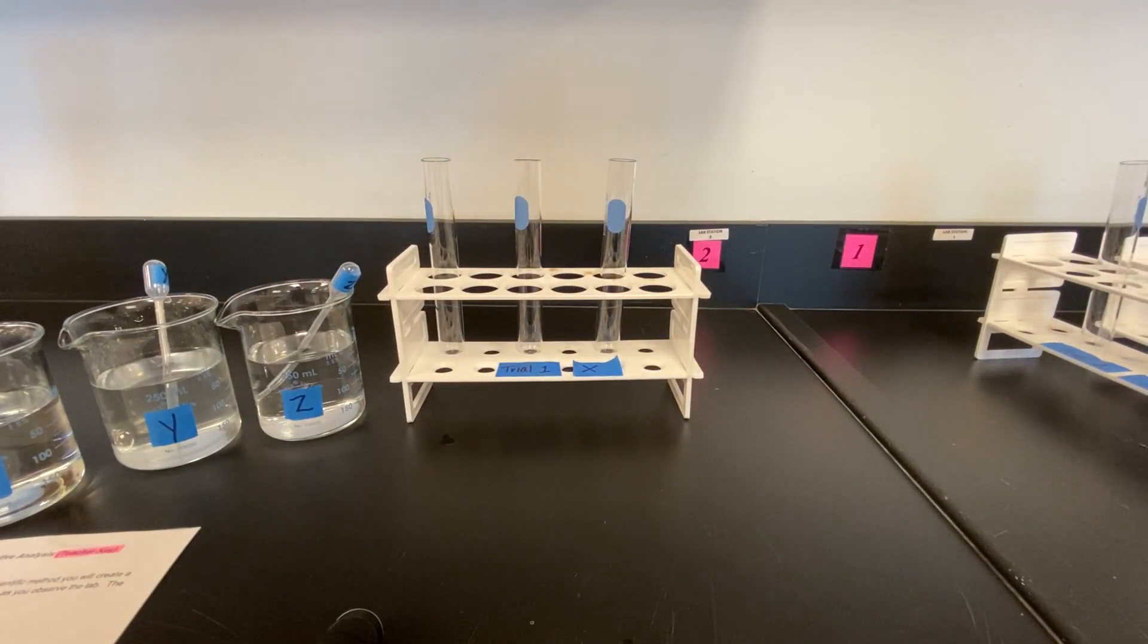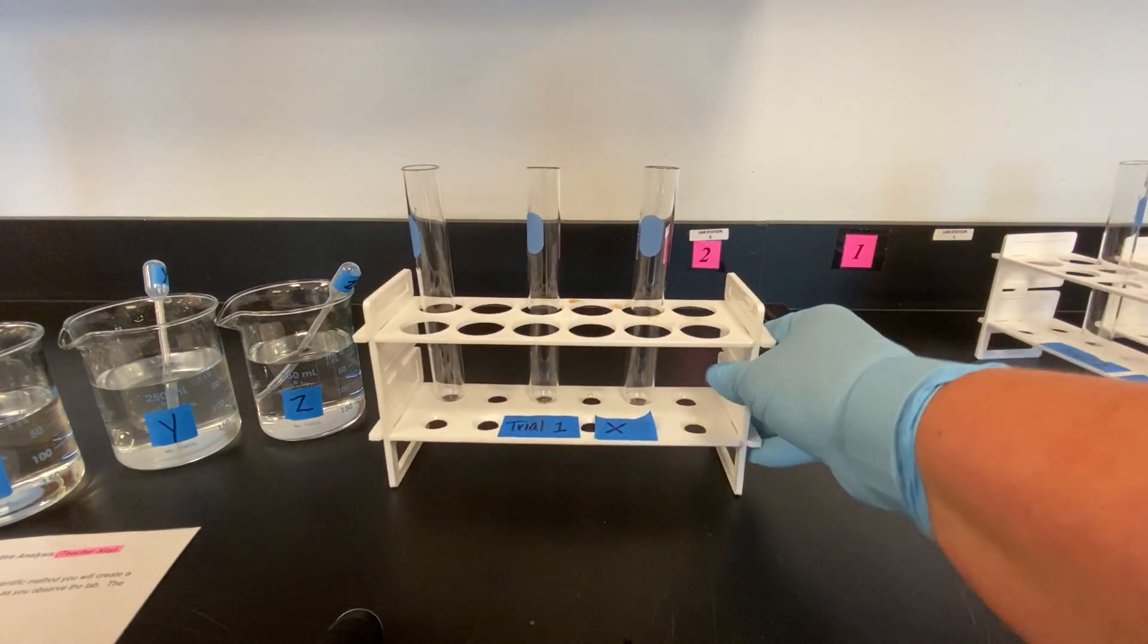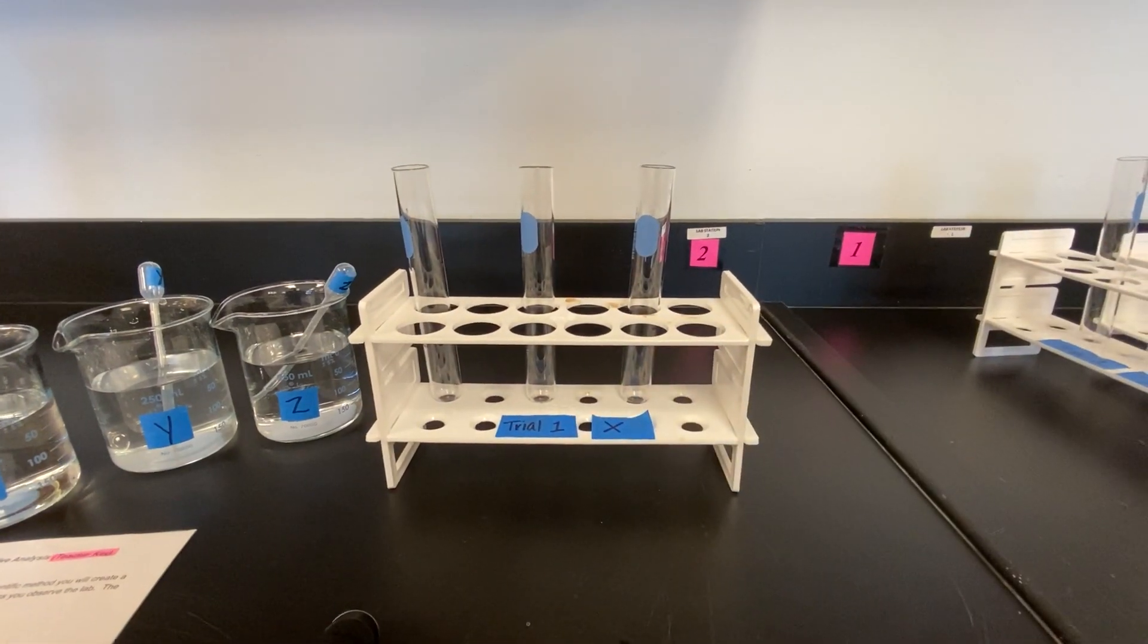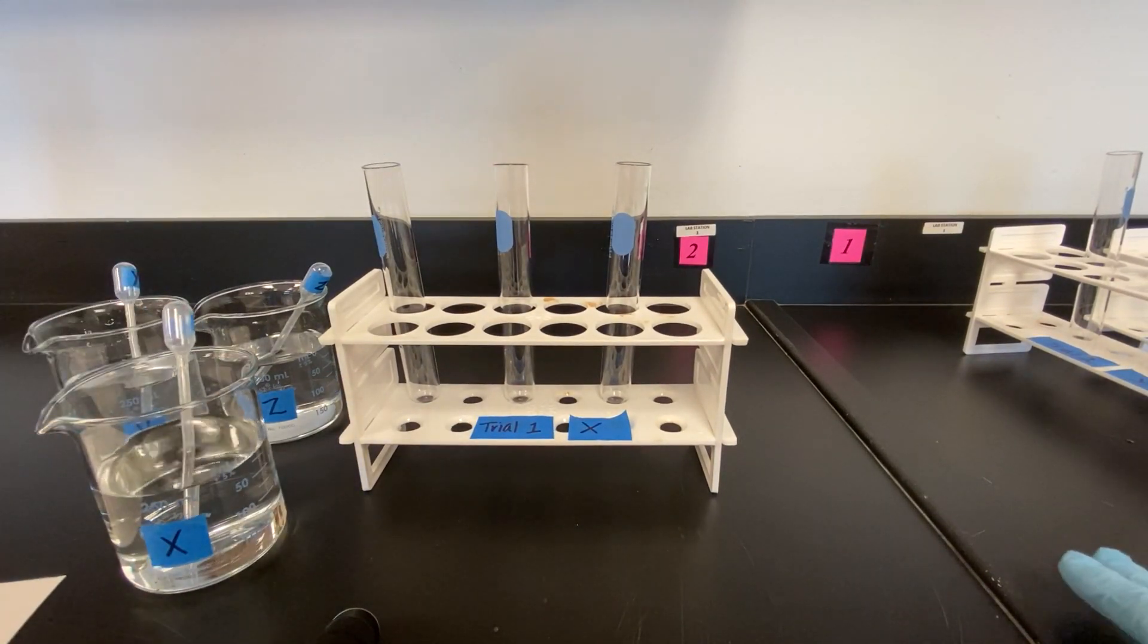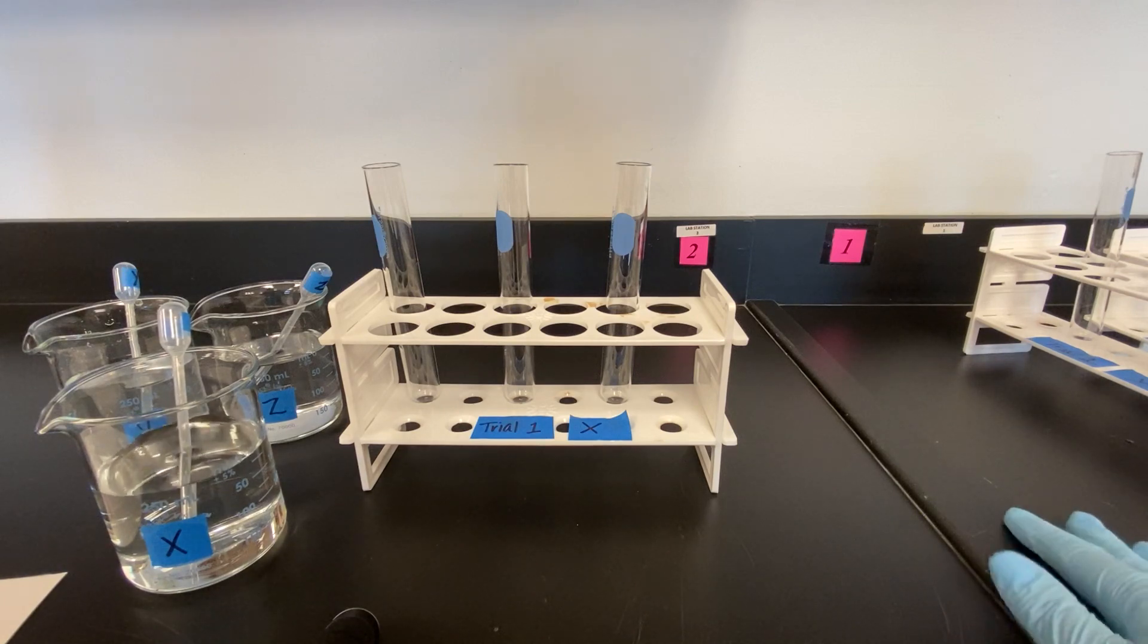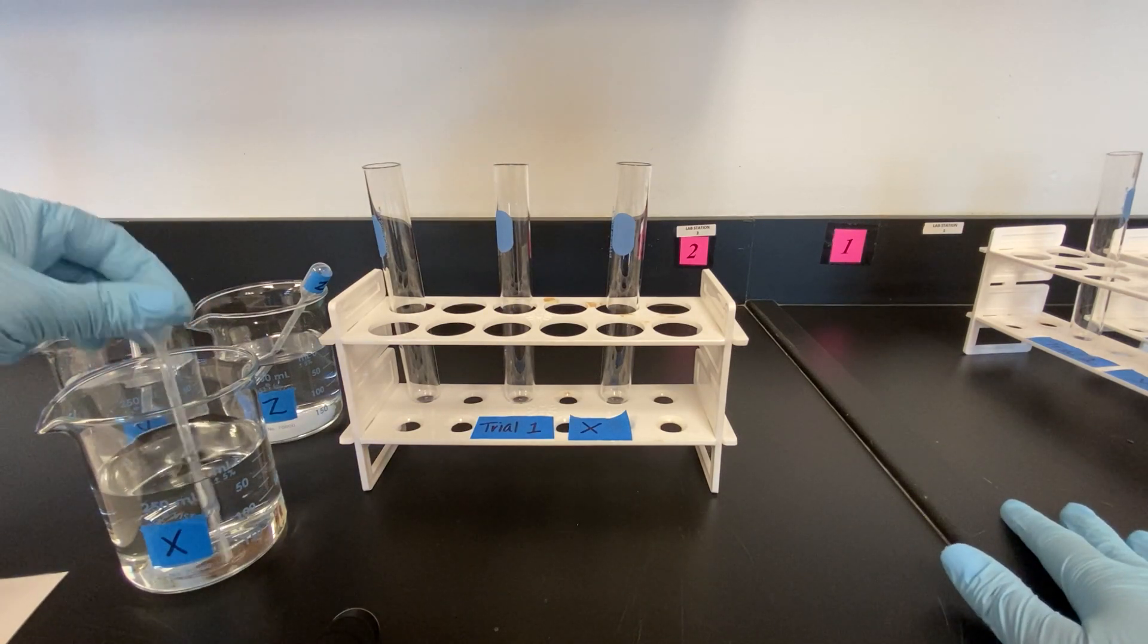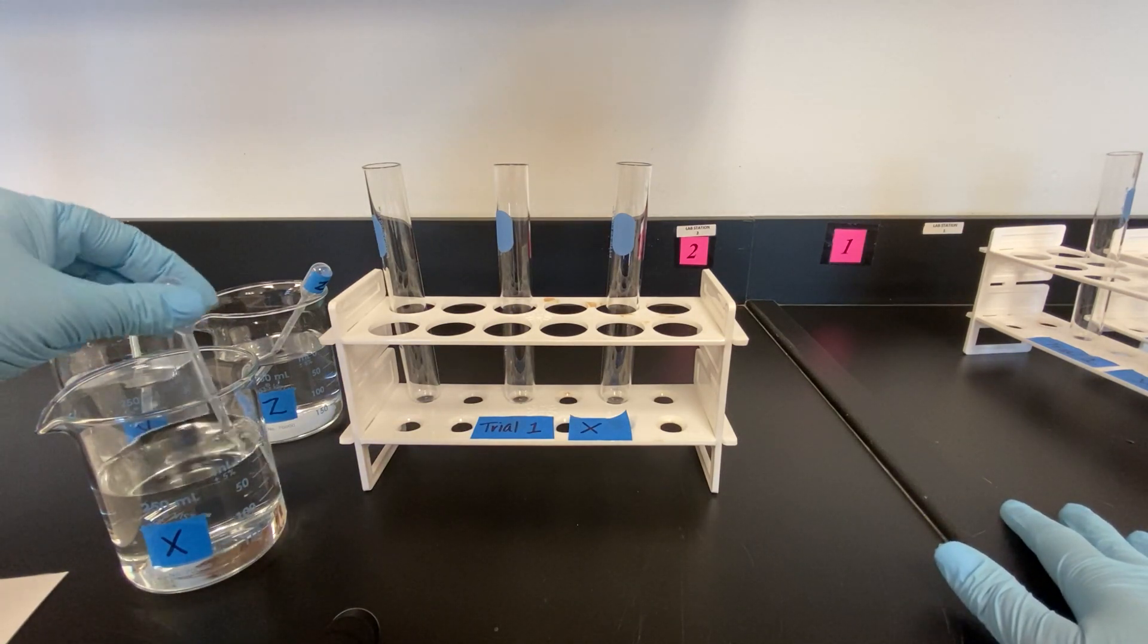Remember in every experiment you must have a control and then you should have a variable. In our experiment today the X solution is going to be the control. So our first step is going to be including the X solution in the base of every tube.